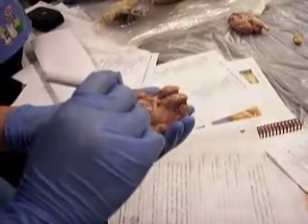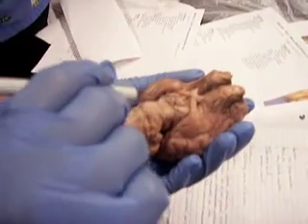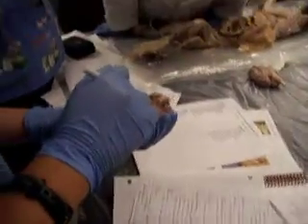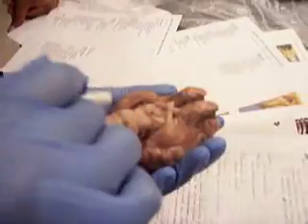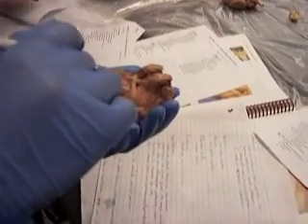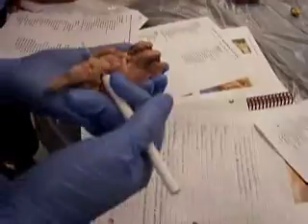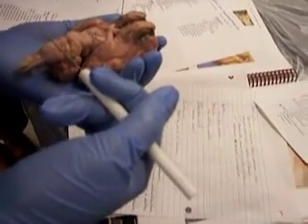And then this little hole right here, that's the infundibulum, and that's what connects the pituitary gland to the hypothalamus. So the pituitary gland would sit right on top of here, and this is a little channel that connects the hypothalamus to the pituitary gland. So when you produce hormones, that's what connects them. And that is it for the outside stuff.